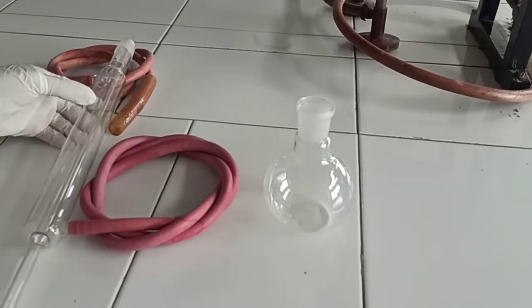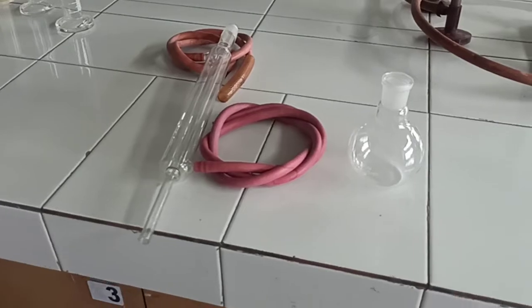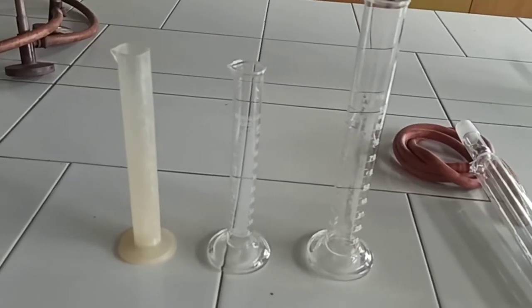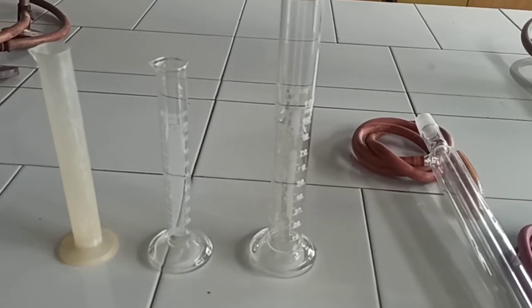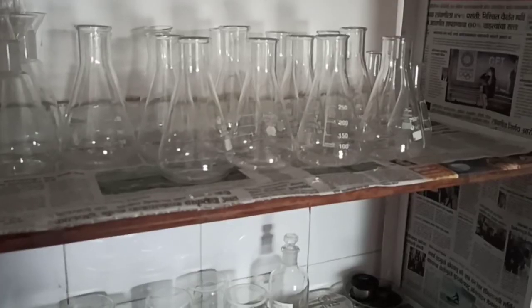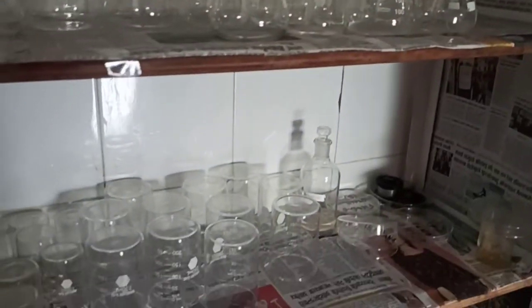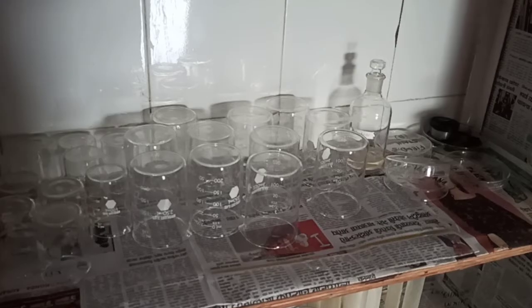This is a condenser and this is a round bottom flask (RBF). This is a flat bottom flask. We require these for the process of synthesis. These are the measuring cylinders, having different capacities like 100 ml and 50 ml. These are the conical flasks. And these are different beakers of different capacities.